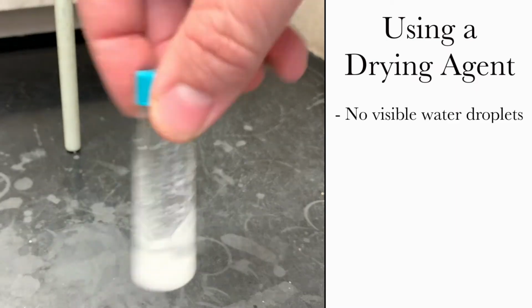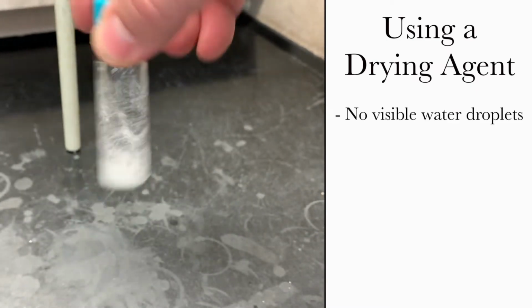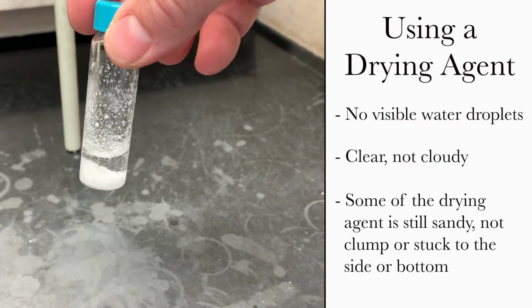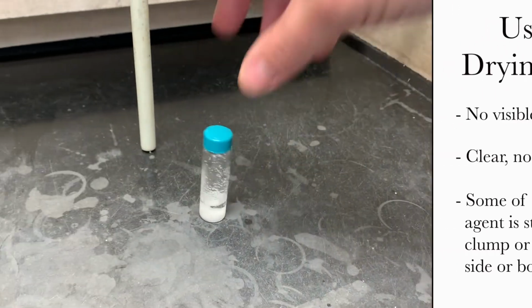First, there's no visible water droplets either floating or sunk to the bottom of the solution. Next, it should look clear, not cloudy or hazy. And finally, some, but not all of the drying agent should be loose, looking like it did in the bottle. Because if those grains didn't clump, they didn't find water.